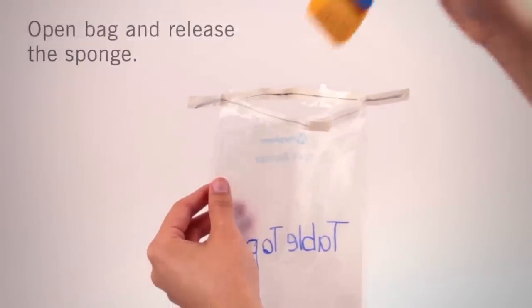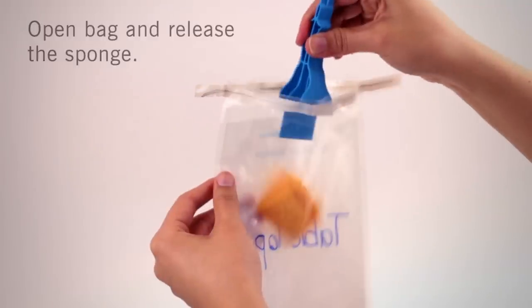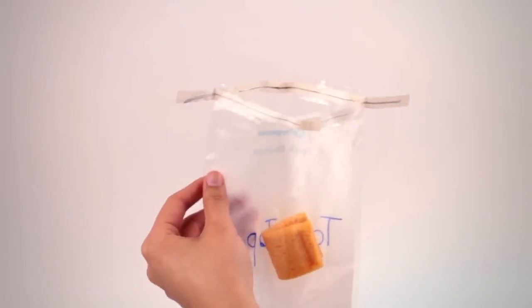Hold stick sponge over the open bag and pinch the wide part of the handle to aseptically release the sponge. You may now remove a sample or add additional media if required.